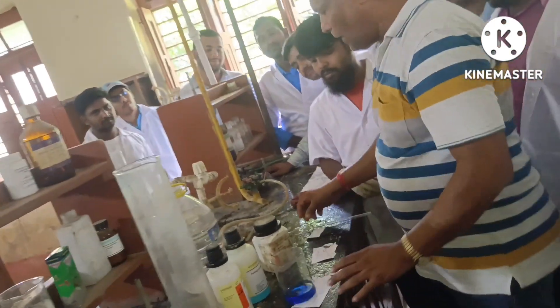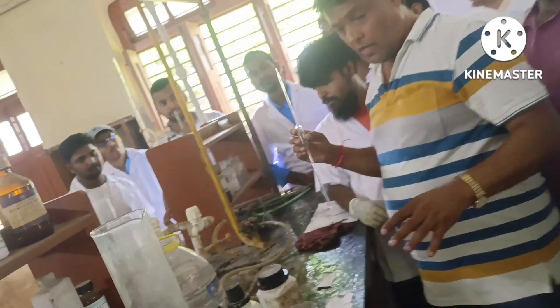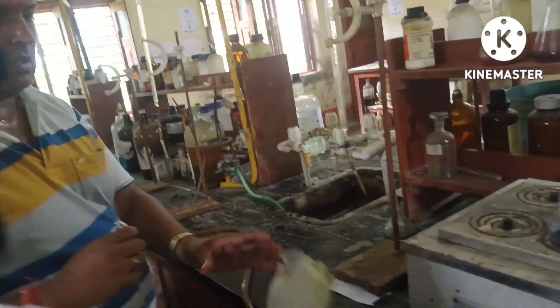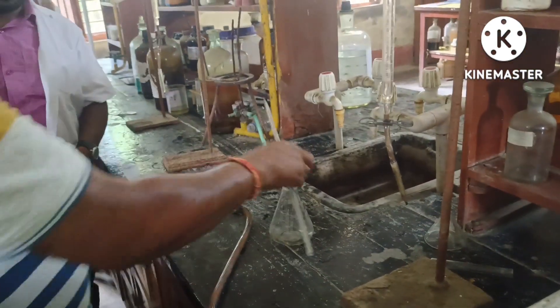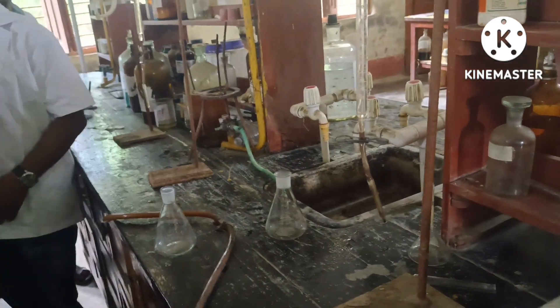We have to choose one conical flask. In this conical flask, what is there? — Fehling solution. We have taken 25 ml of Fehling solution.